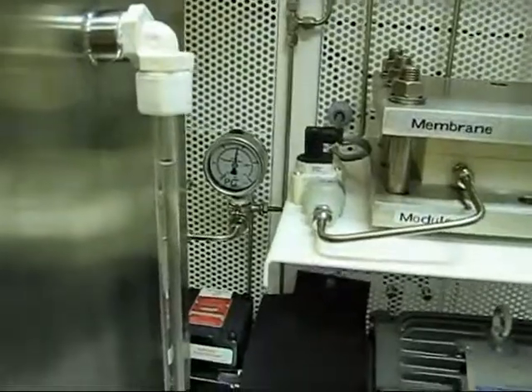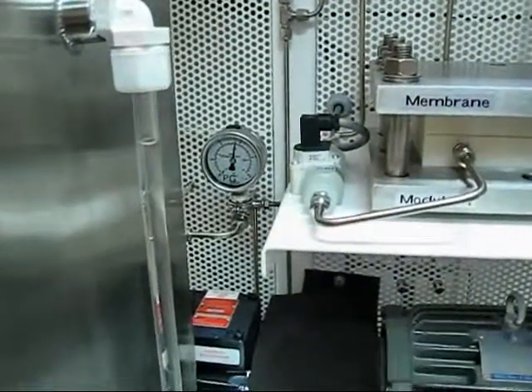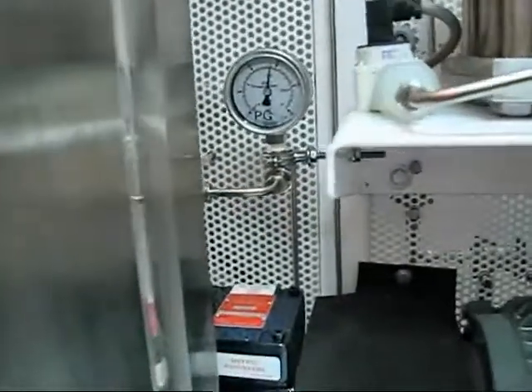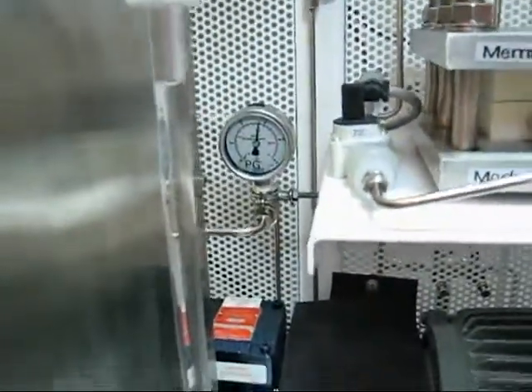You'll notice that the feed pump has got a pressure gauge and it's fluctuating at a value of about 14 bar at the feed side.